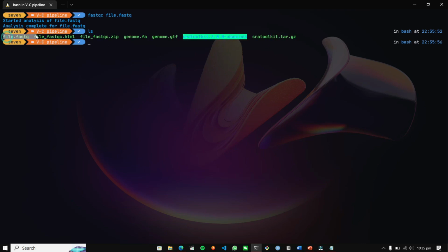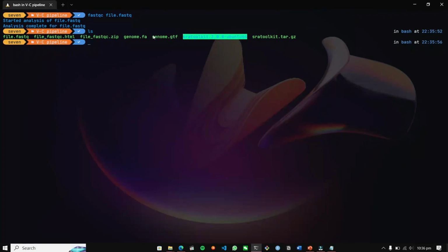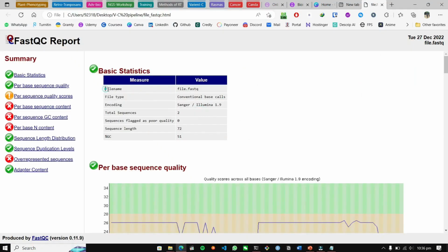Here file.fastq was our FastQ file. And file_fastqc.html will be the result file of our SRA data. Yes, here it is. It's showing the file name, file.fastq. It is encoded by Sanger Illumina sequencing, and the total number of sequences present, because I trimmed out all the other sequences, is 2. The sequence length was 72 and the GC content was not enough.